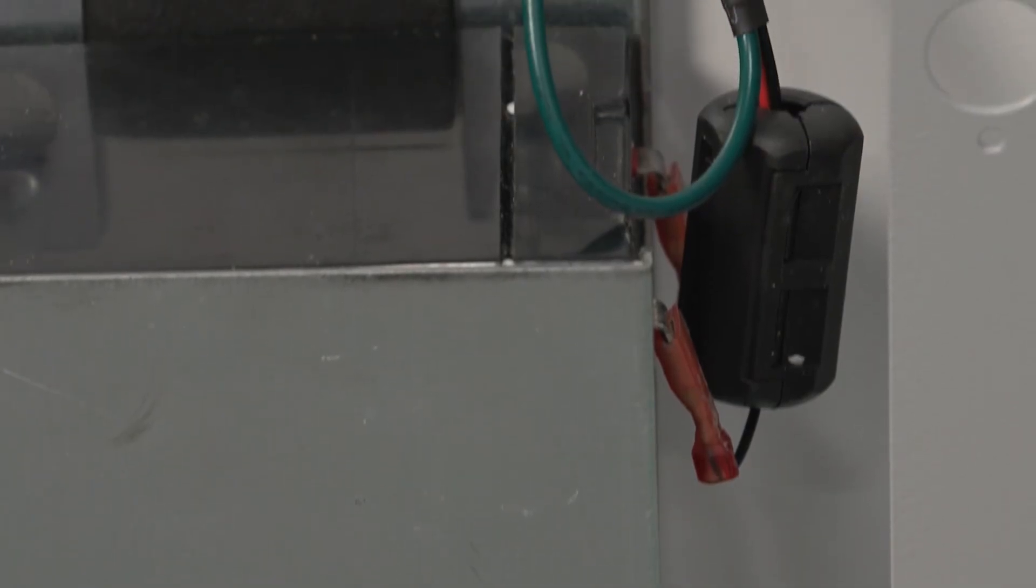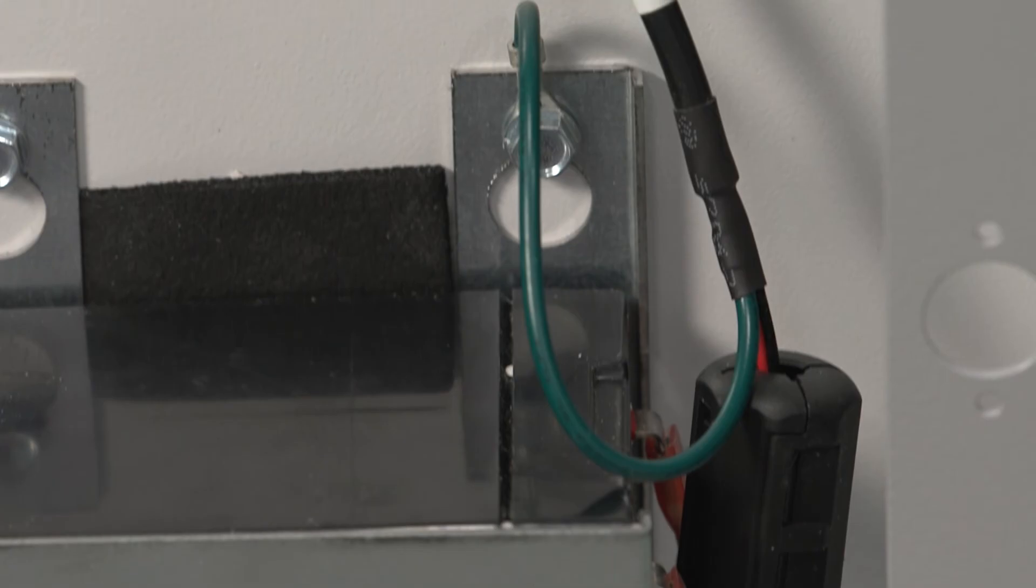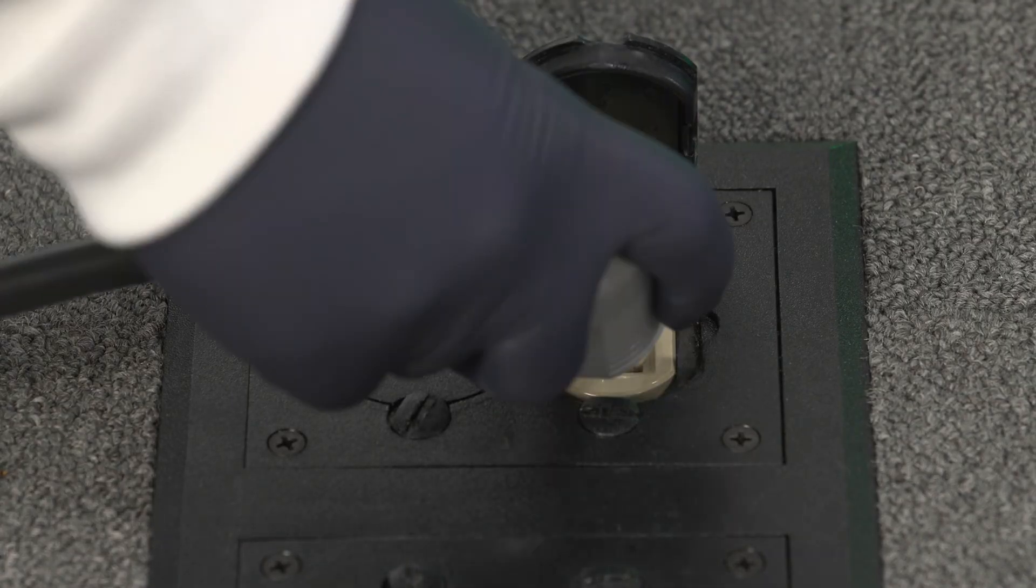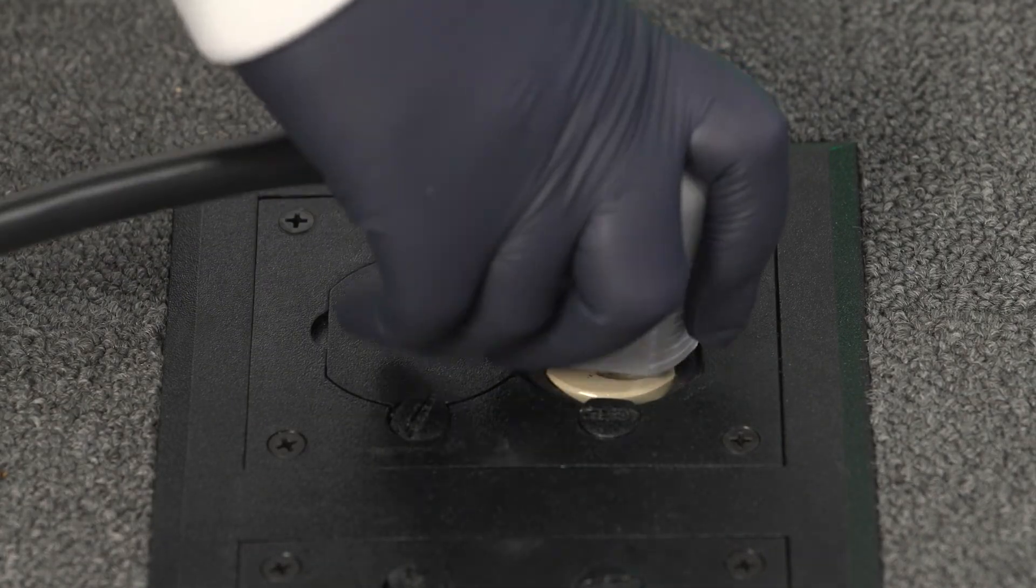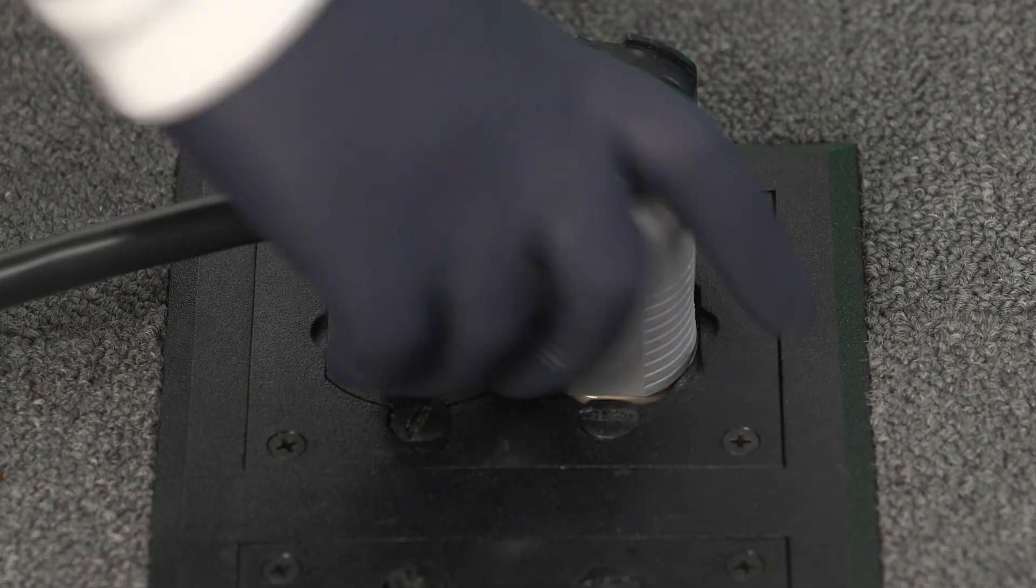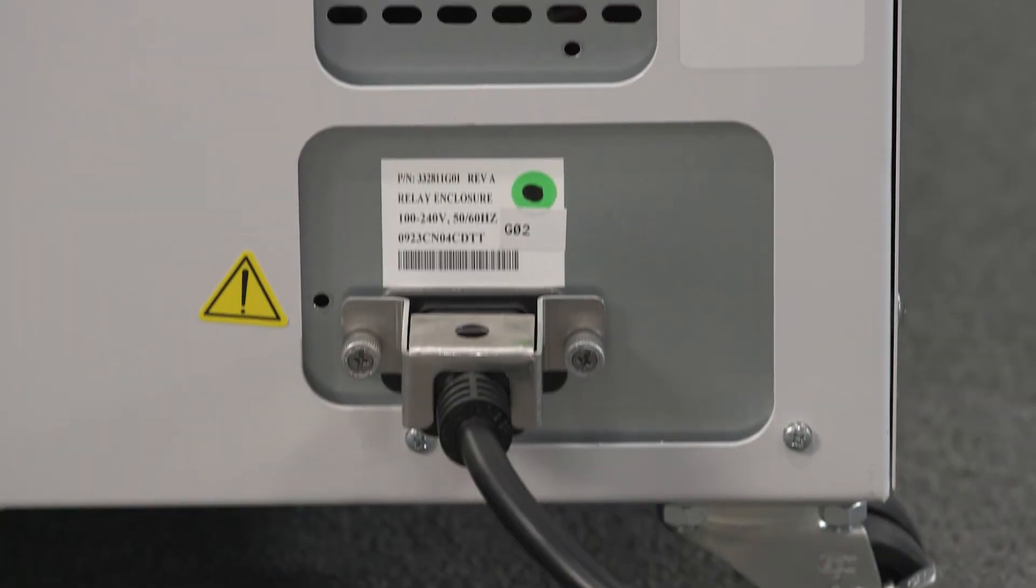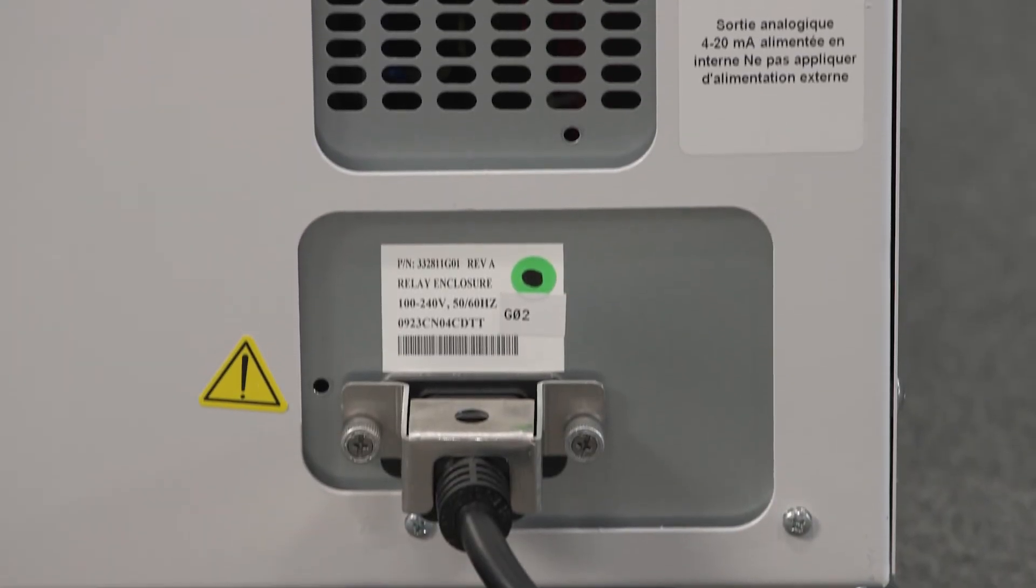Check that all the wires to the battery are firmly connected. Also check the main power cord to be sure that it is properly inserted into the wall and that the cord retaining bracket is installed.